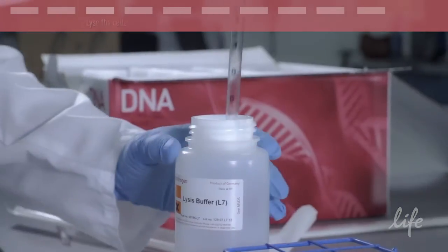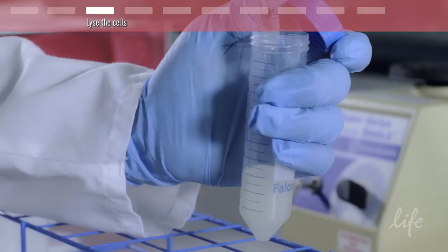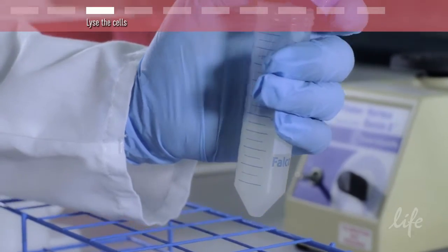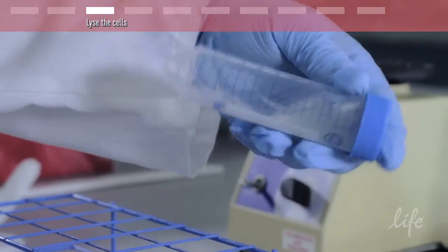Next, add lysis buffer and mix. This opens the cells to release the plasmid DNA.